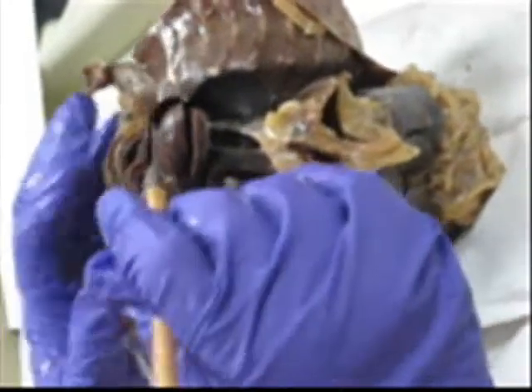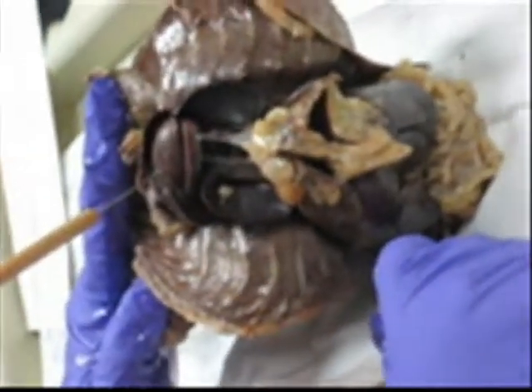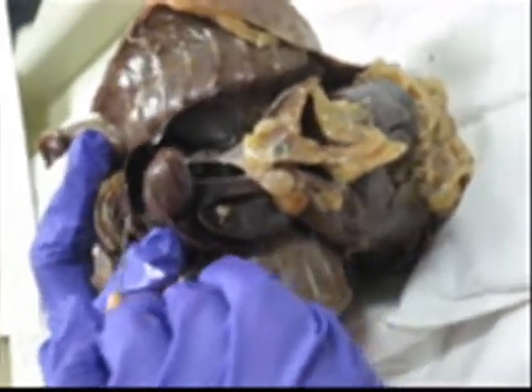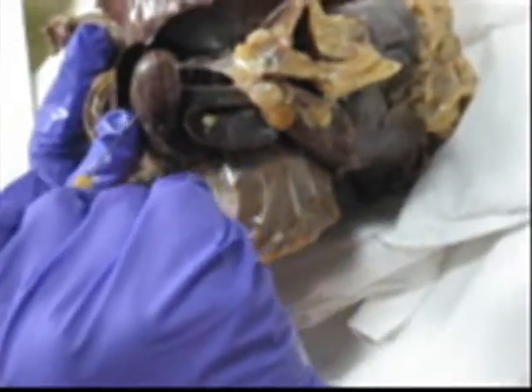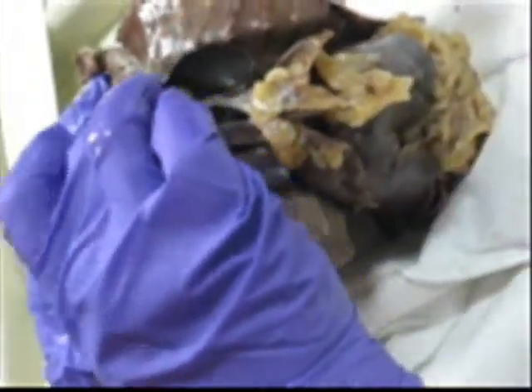On the heart, if I pin a vessel that is blue or green, then that vessel would be the coronary vein. If I pin a red one, it would be the coronary artery. If I pin somewhere totally random, away from these vessels, then I want the heart.